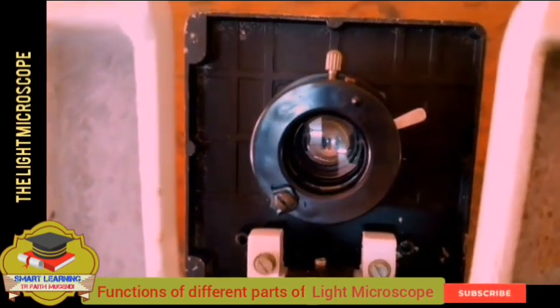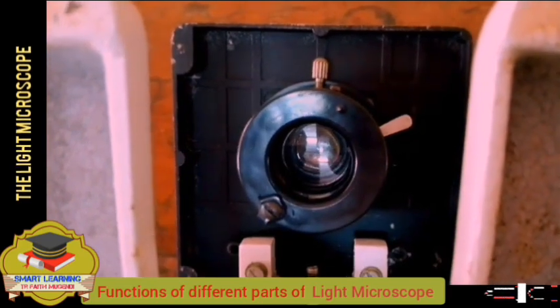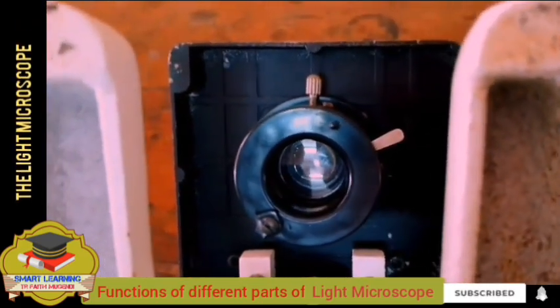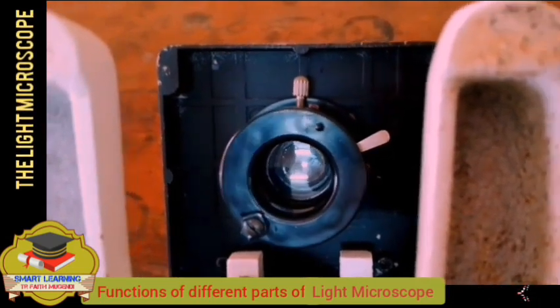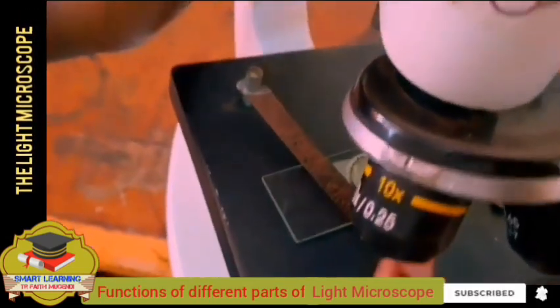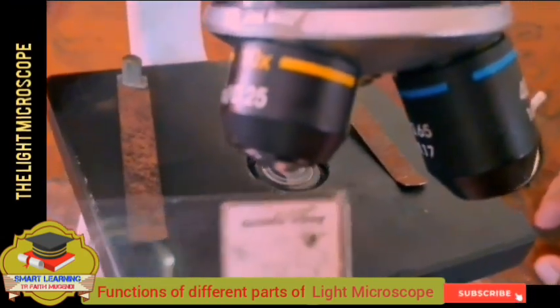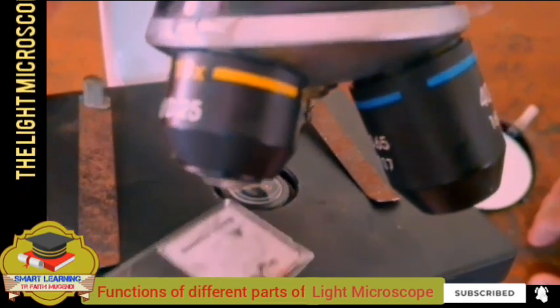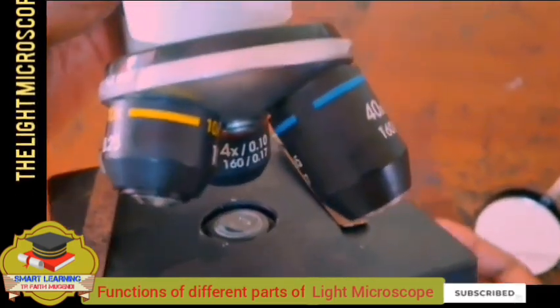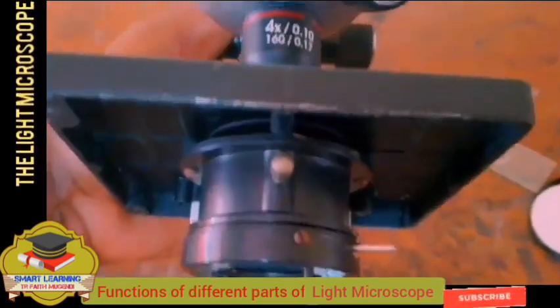That's why we are saying it's a system of lenses that concentrate. After the mirror directs light inside the microscope, the condenser concentrates the light and directs it to the specimen. The specimen is usually on the stage. So the specimen is here. That is why everything is directed to the stage, to the specimen. We shall talk about the stage later. As we proceed, be sure to remain here.